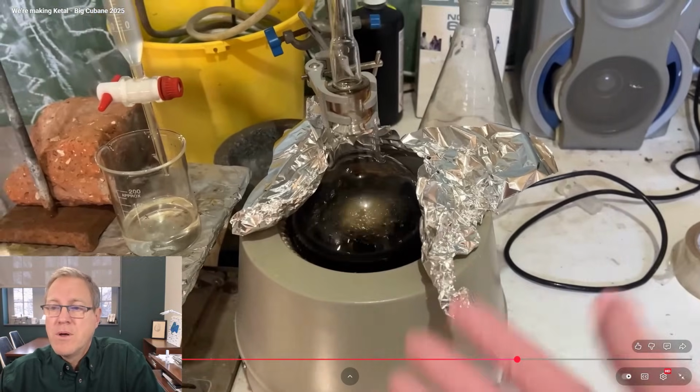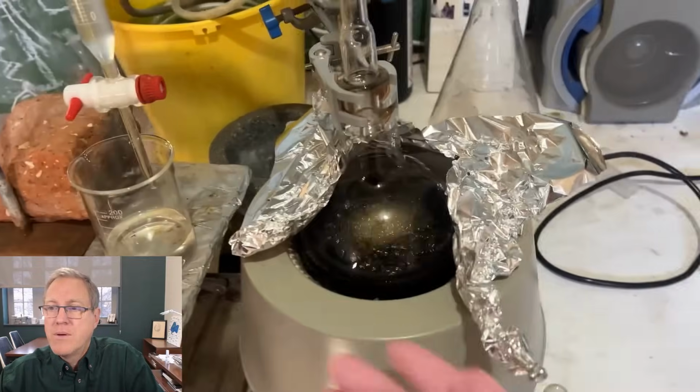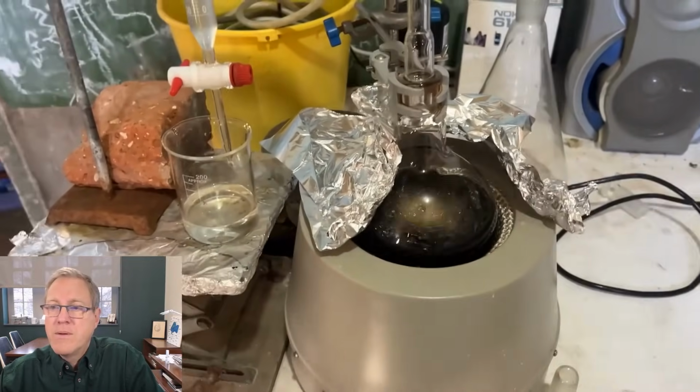It's very black. It's very black, but we got quite a bit of water, so it implies there's at least some reaction going on. We just have to be optimistic. The only other alternative is just to abandon this and go live in the woods, you know what I mean? You just have to persist, despite the horrors.